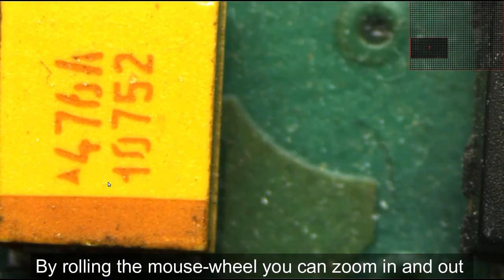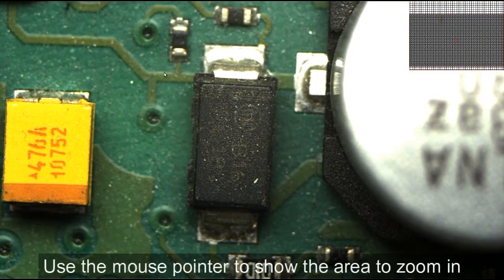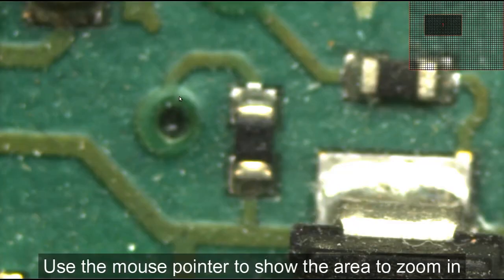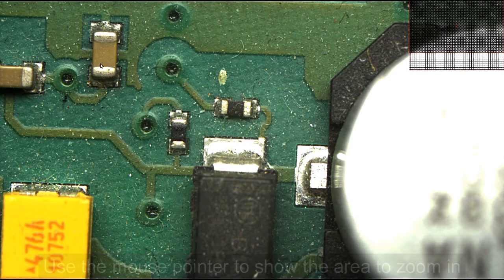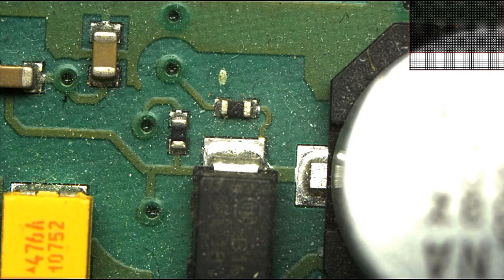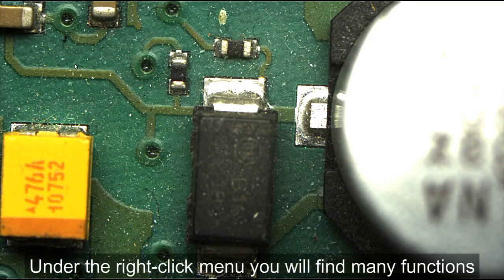You can zoom in and zoom out by scrolling the mouse wheel. You can use the mouse pointer to point to zoom in, then roll the mouse wheel. You can activate the menu by right-click with the mouse. Here are the functions of the menu.